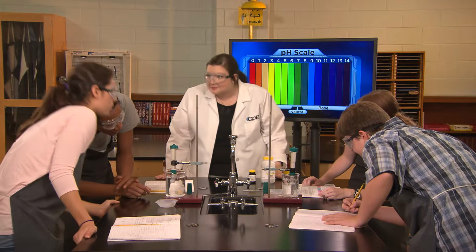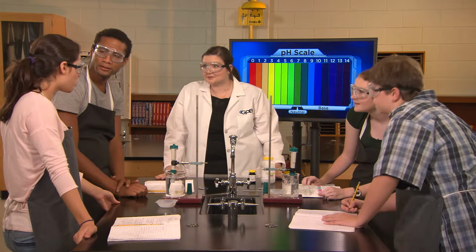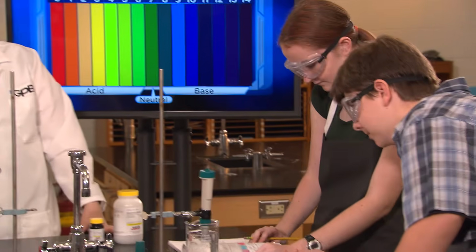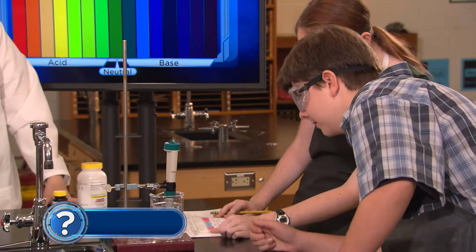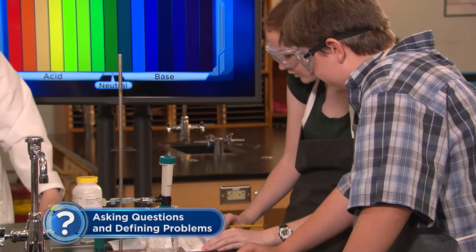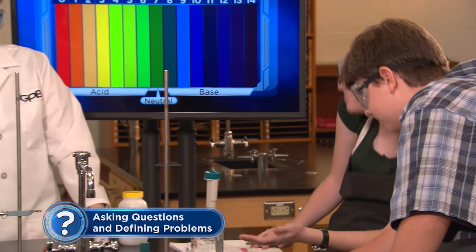Wow, that's weird. The pH dropped almost to 3 after the zinc nitrate was added. Ours is even lower. Ours went all the way down to 2. But how does it do that? I mean, there aren't even any hydrogens in the formula for aluminum nitrate. How is the pH going down?